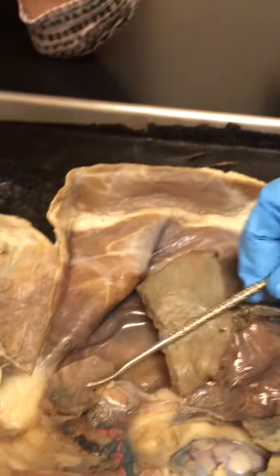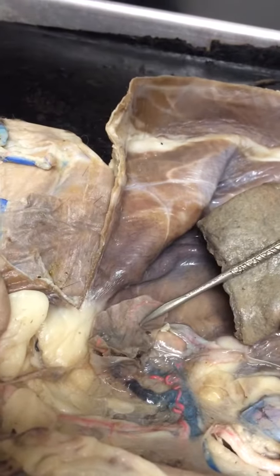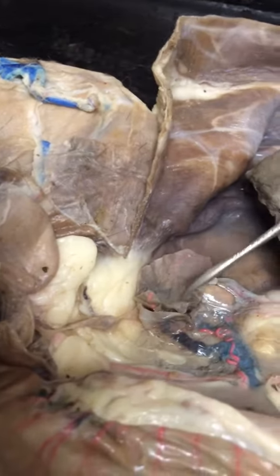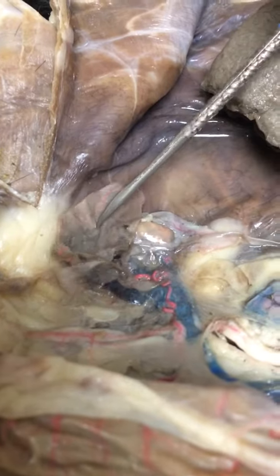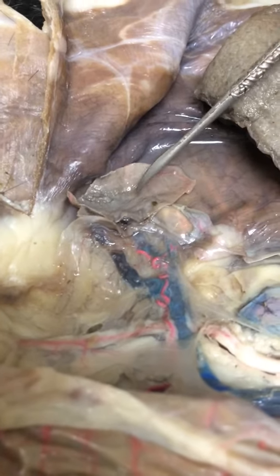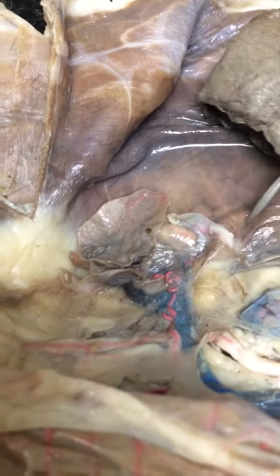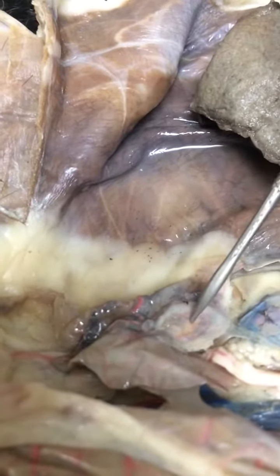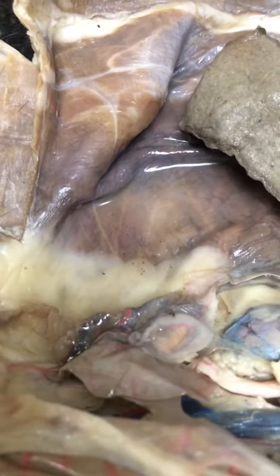Right here, sorry, I'll move my hand out of the way. Right here is an ovary. All right, so that's your ovary. It's the hard circle that looks kind of like a mini kidney. That's your ovary. No, just a little bit above it. Here? That hard circle. Yeah, ovary. Okay, ovary. All right. Sorry.